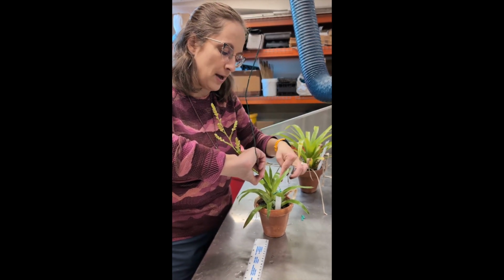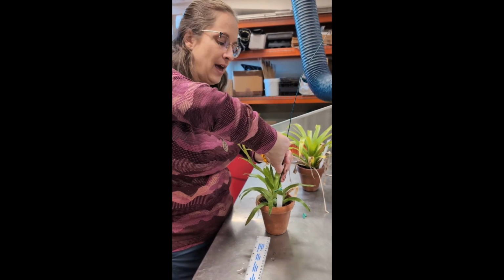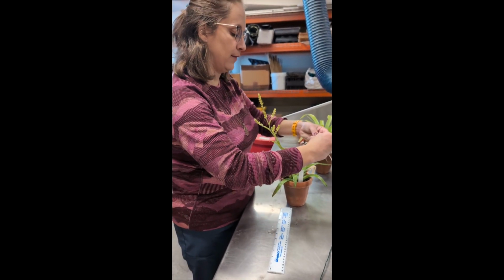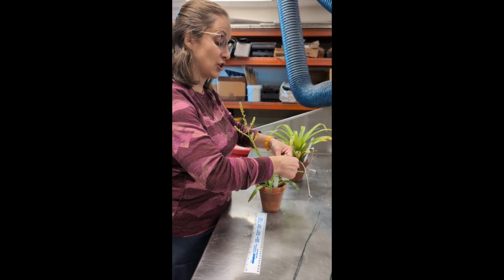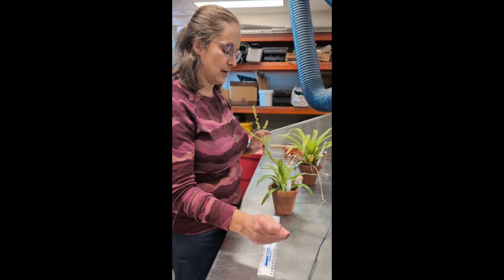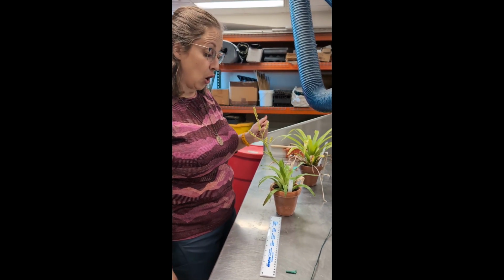So then I just go back to the one that was slightly longer than, but not shorter than. I'm like, okay, you are my very special 75% of this young leaf. So this is essentially the stopping point of counting. Okay, in fact, I'm gonna remove this one so we're not distracted by which one. So how many green leaves are there?